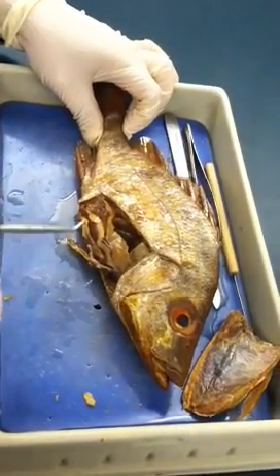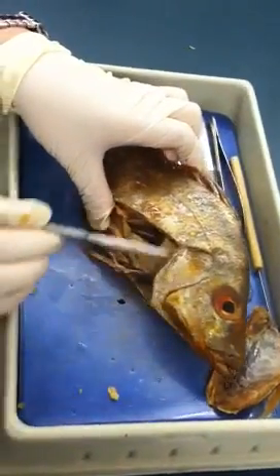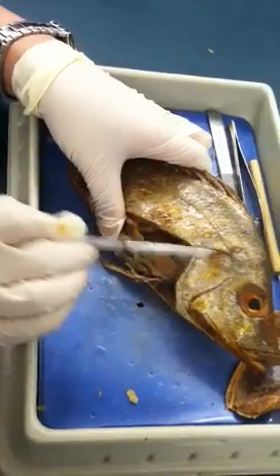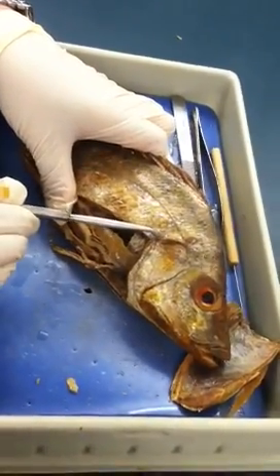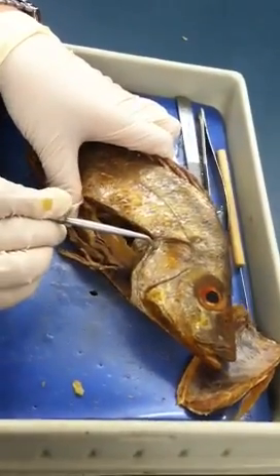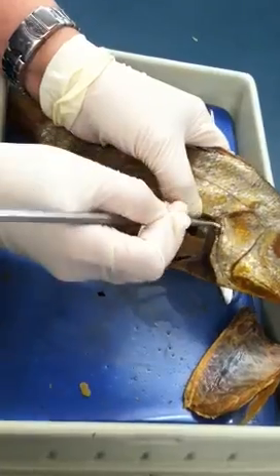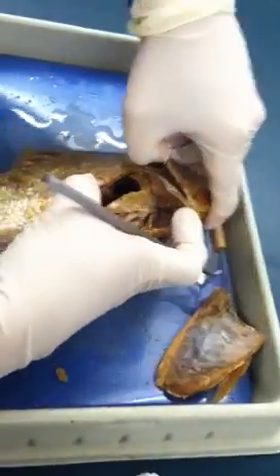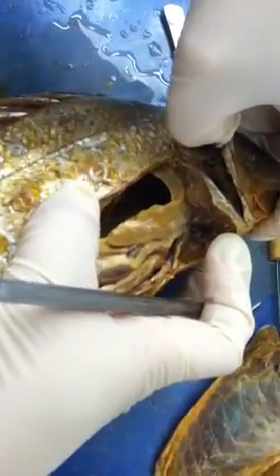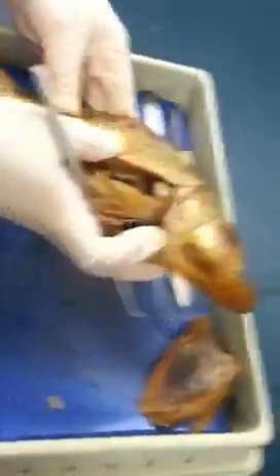For the circulatory system, don't worry about that because we have to cut this one open. And for the external, close to the head — when you touch it, it's very hard — that's what we call the operculum. Operculum describes something very hard; it's for protection. And if you lift the operculum up, you will actually see gills beneath it. So just remember: operculum is the protection for gills.